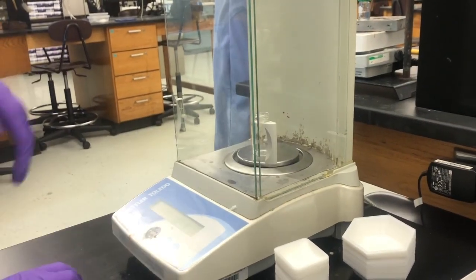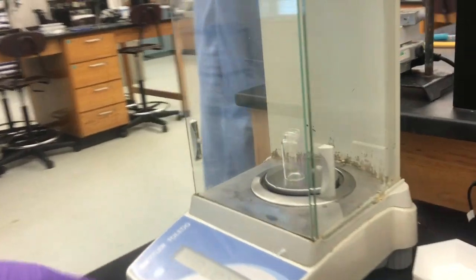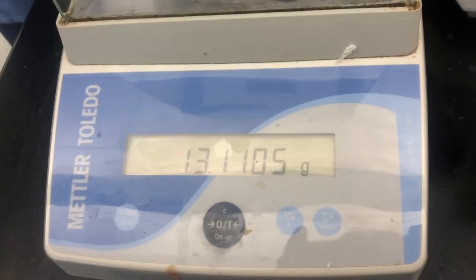While you wait for the aluminum block to heat up, obtain and pre-weigh a vial. You will need this later for your calculations.